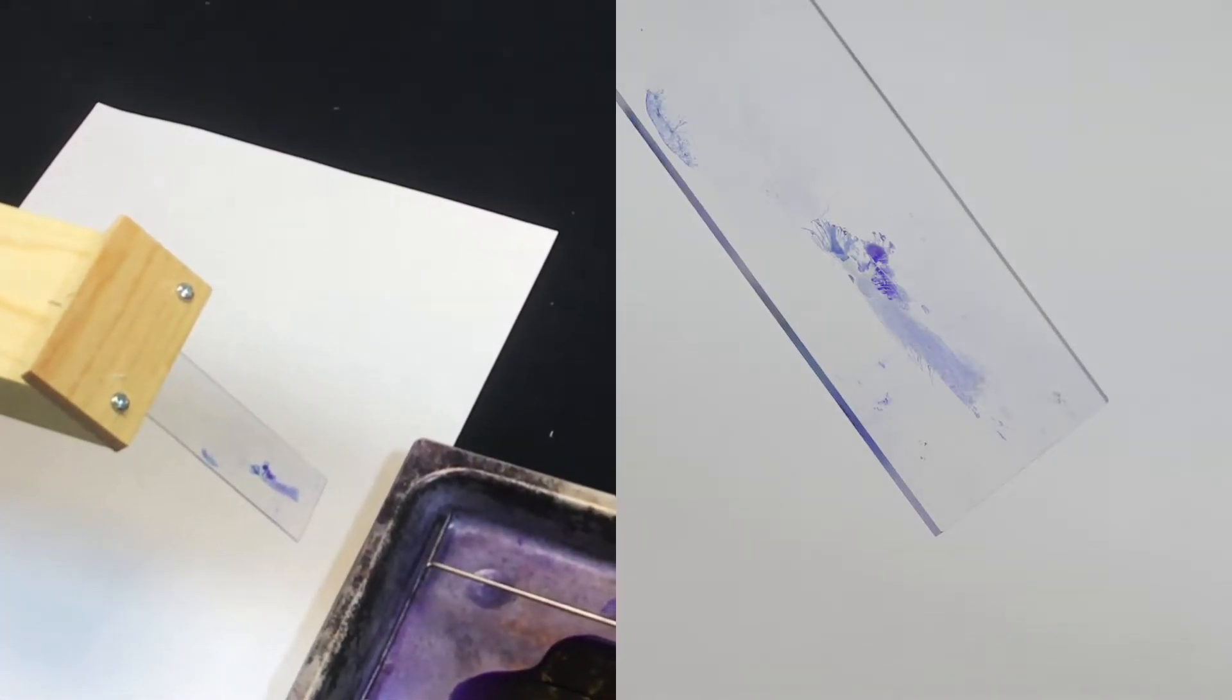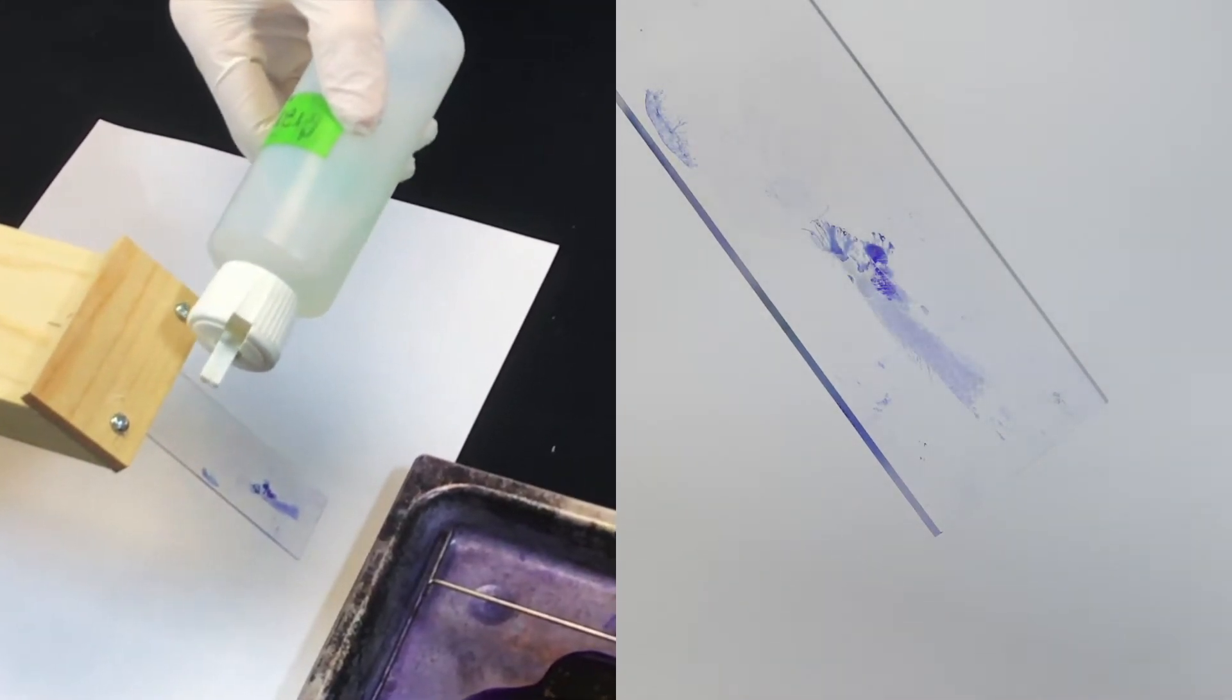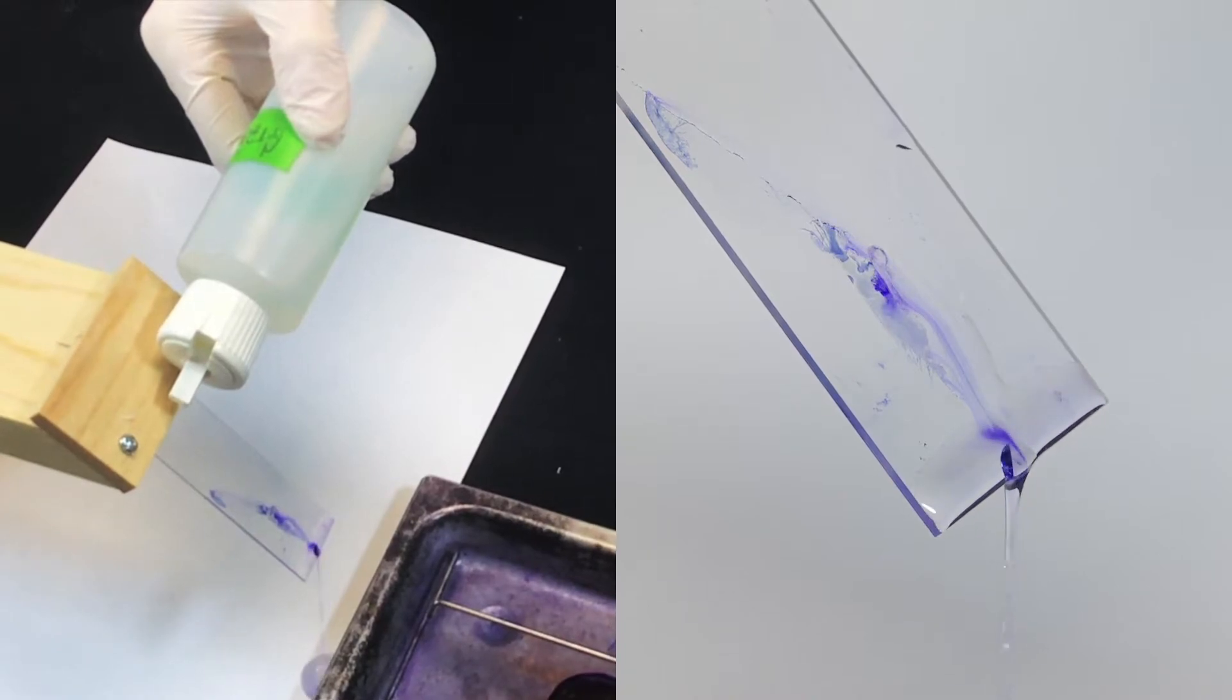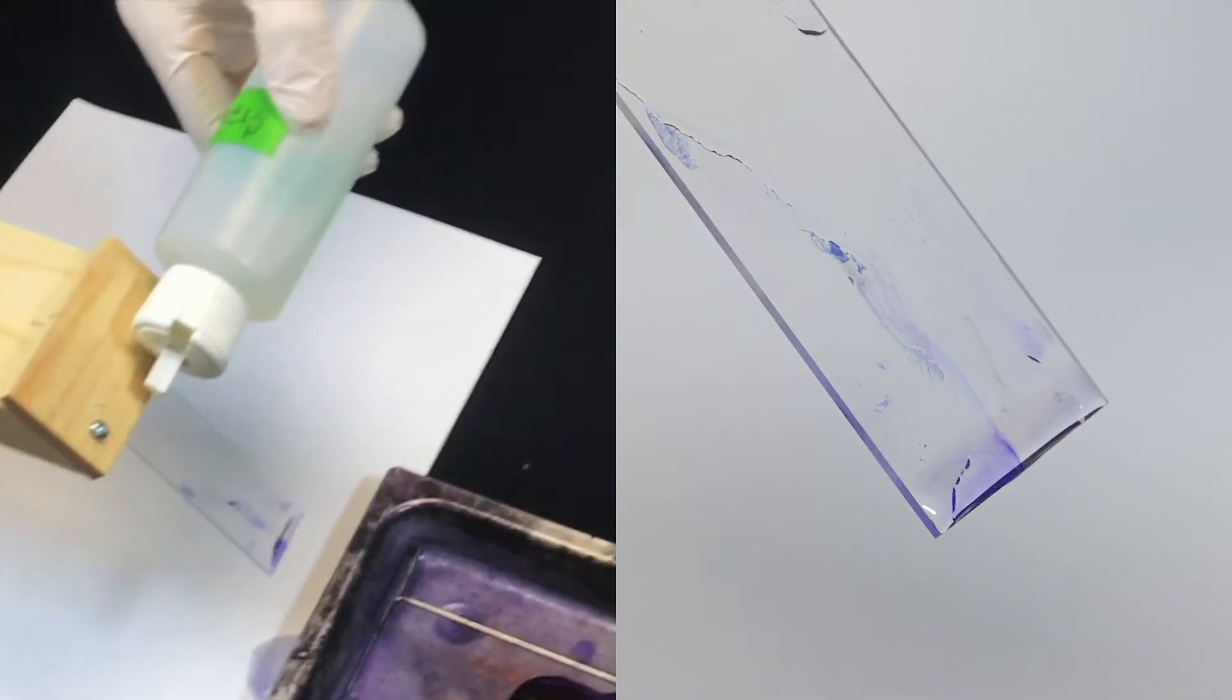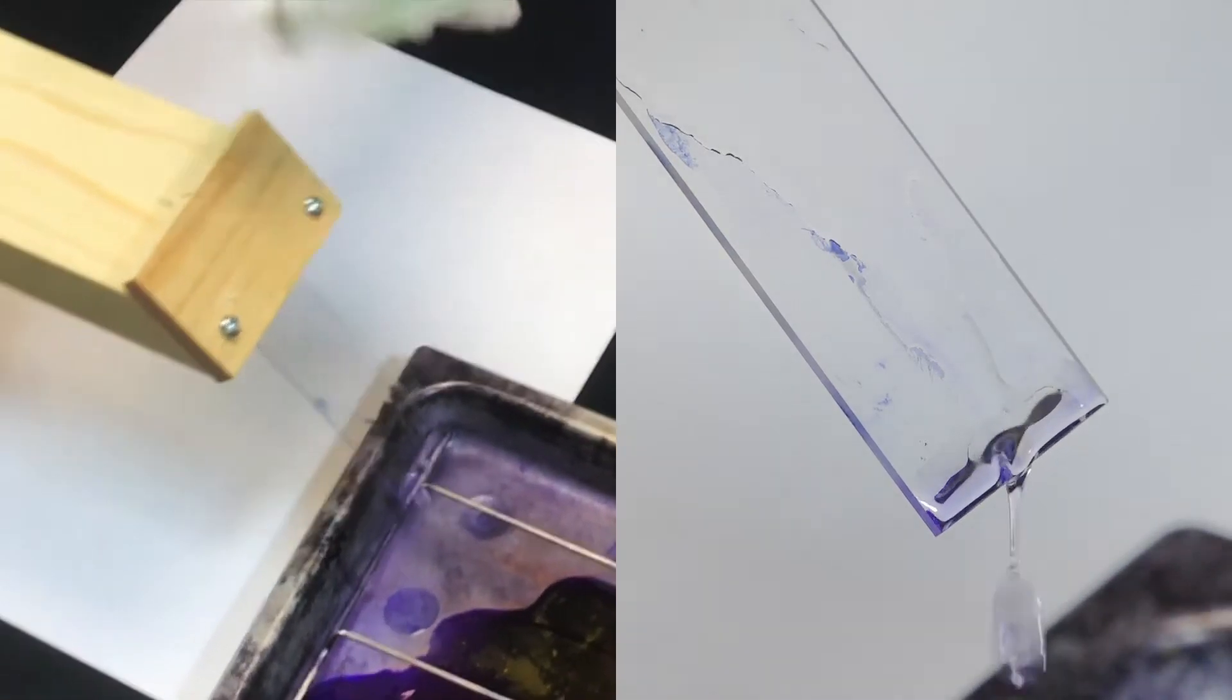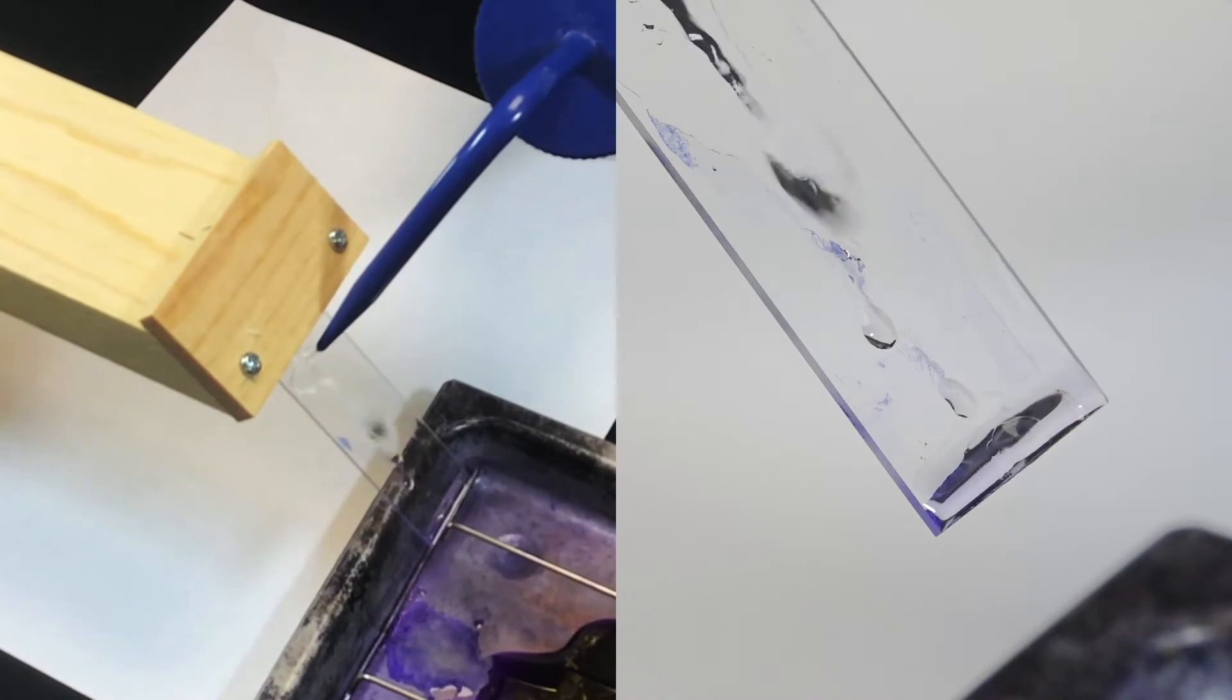I'm going to decolorize this slide in the exact same way. And rinse immediately with distilled water. Again, spray above the smear.